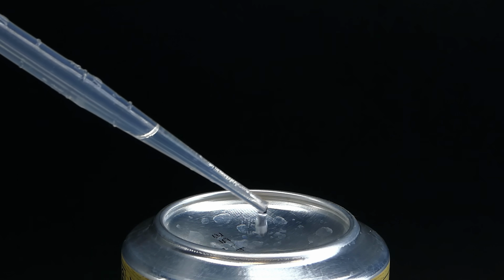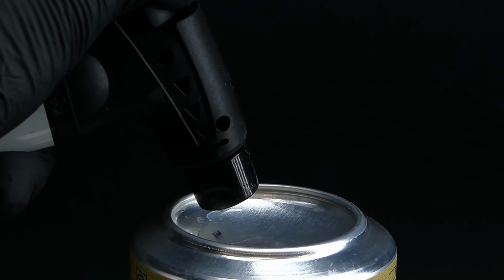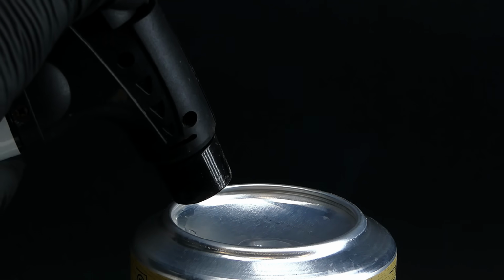I firstly wanted to see how it burns. It is mostly made out of carbon and doesn't have much water in it, so I expected it to burn quite fast, but it turns out that it has trouble even igniting. It barely can sustain a small and dim blue flame, which is quite disappointing, but at least proves that it is not too much of a fire hazard.